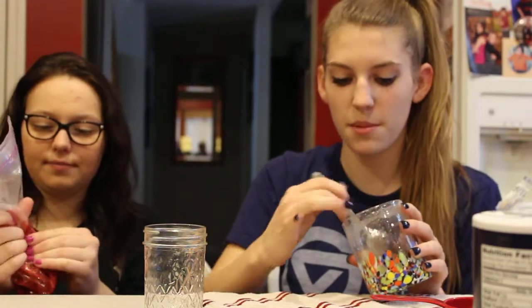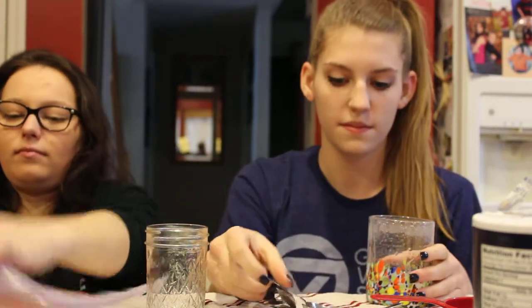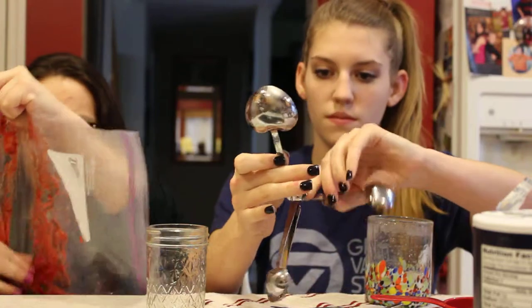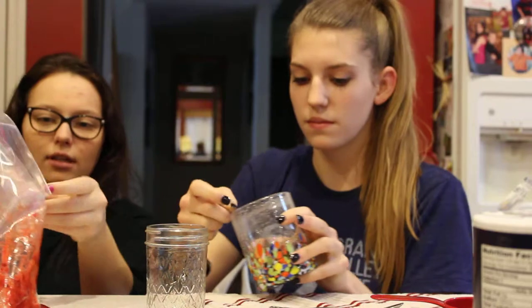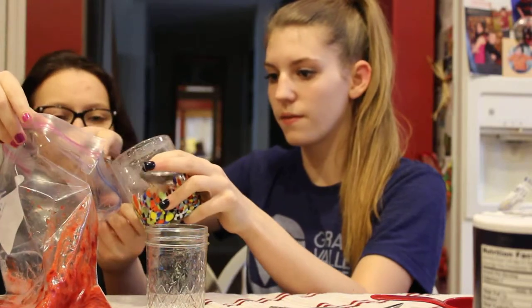When she's finished mixing up the strawberries, I'm going to add three tablespoons of the extraction liquid to the Ziploc bag and then we're going to mush it up again. Next I'll mush the liquids together for approximately a minute, then I will pour it into this cup making sure I only get the liquid and not the strawberry pulp.